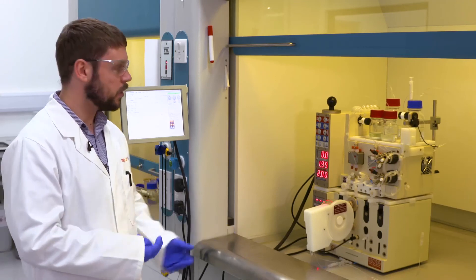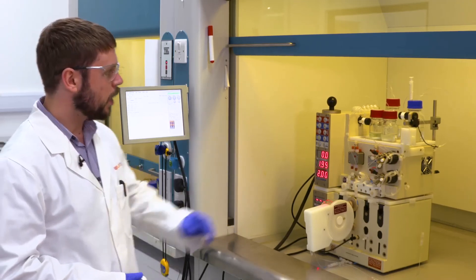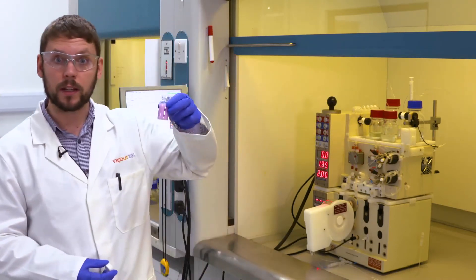Now the reaction is finished. FlowCommander is taking the R-series through its cleaning cycle and we can look at the product that we've collected.